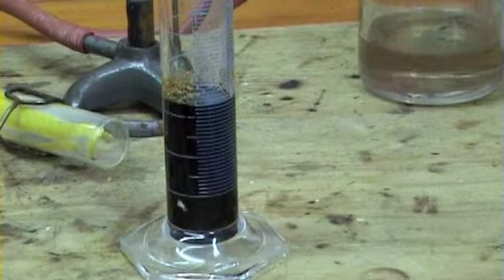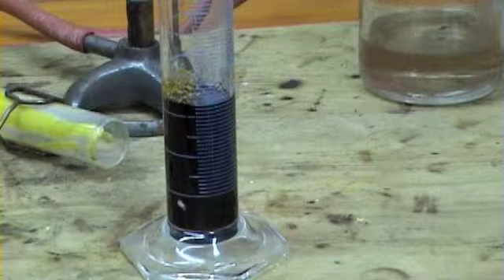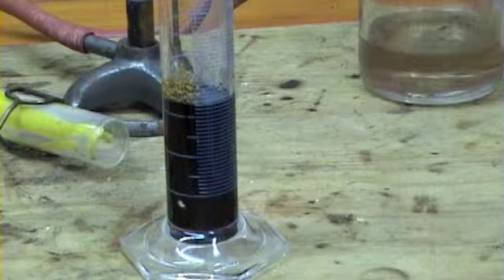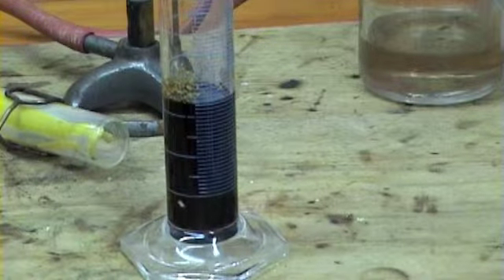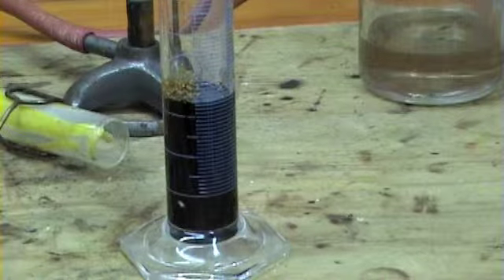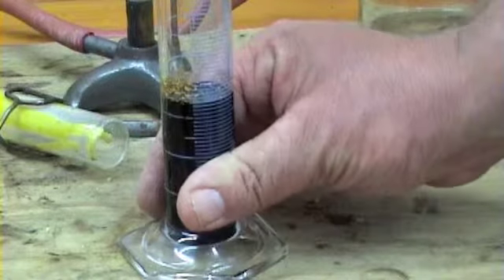I could. The short answer is I could, but the reason I wouldn't is because when this charcoal starts forming, assuming it forms a big sort of chimney stack of stuff that's kind of like a crystalline thing, and it bonds around things, and basically this measuring cylinder is going to get thrown out after this. It's almost impossible to clean off. So if you put a thermometer in, it'll just cling on there as well. Yeah, yeah.